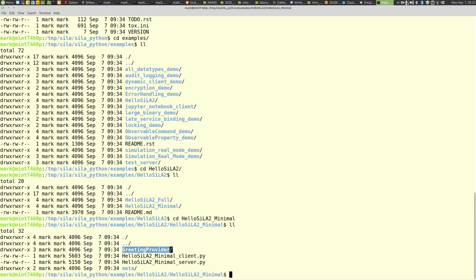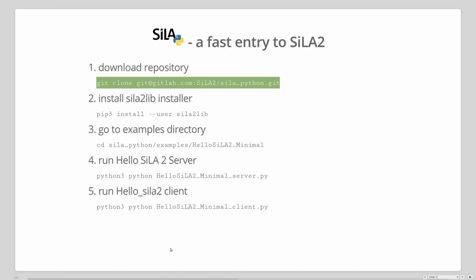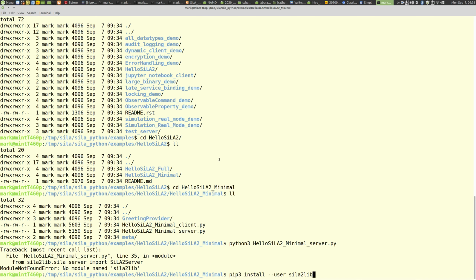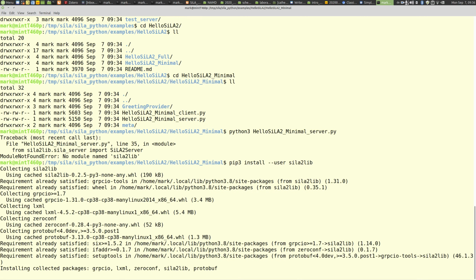So let's run the server. You run the server very easily with python3 and then the name of the server. Sorry. I forgot to install the library, of course. So pip. Let's do that quickly. Pip install the library. This is also very fast.